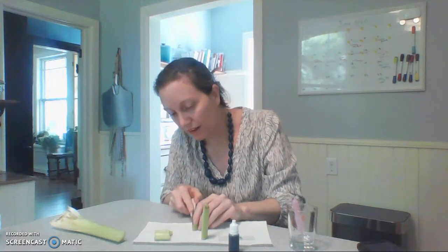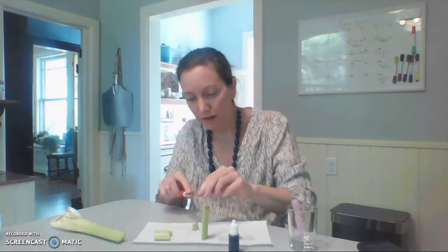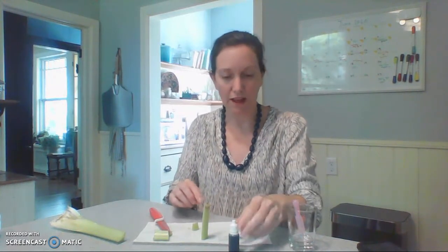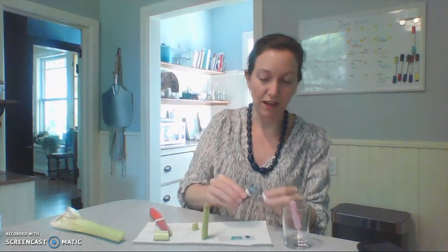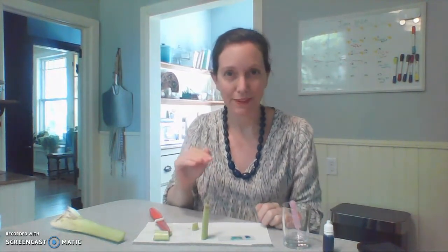Then I make a very, very thin slice in the up-and-down direction. If you don't get all the way down, it's okay. Something very, very thin that light can shine through it. To do this longitudinal slide, you do the same thing — put it right on the microscope slide, a drop of water, a drop of stain. This can go right next to the other specimen. You need a cover slip to protect the objective lenses.